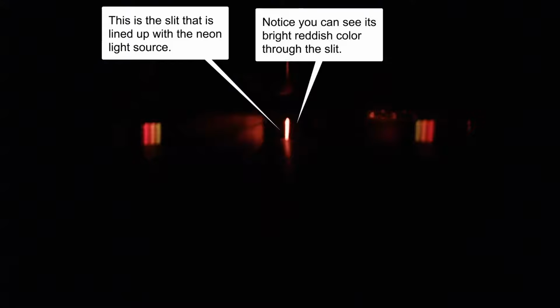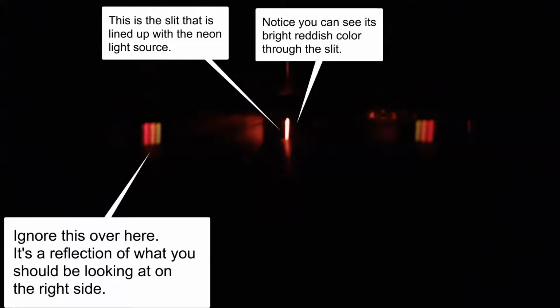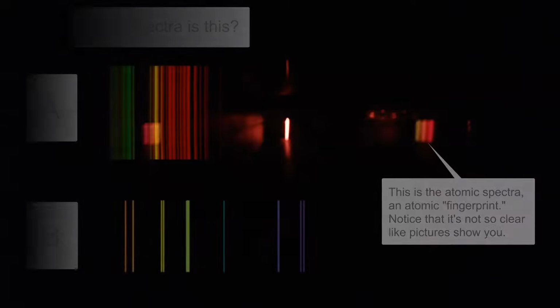I've lined up the neon light source with the slit on the spectroscope, and you can see the reddish color through the slit. But we want to ignore this thing on the left. That thing on the left is a reflection, and it's going to screw you up if you look at that. So you only want to focus on the thing on the right. In a second, I'm going to get rid of all this, and I'm going to cover up the thing on the left with choices so that we can try to match it up.